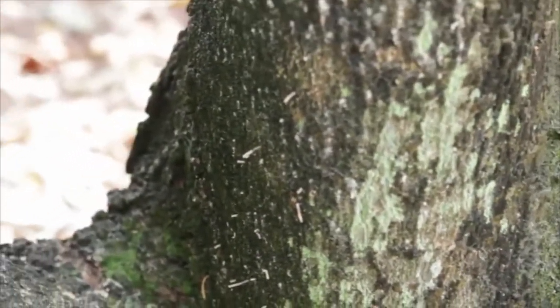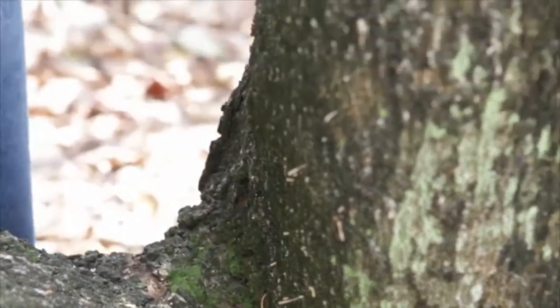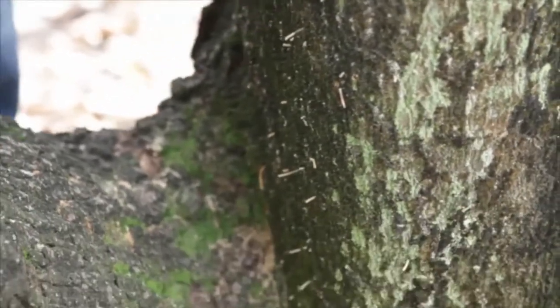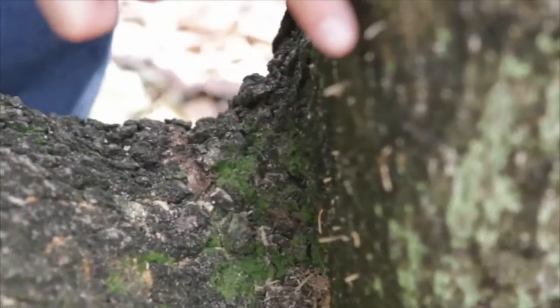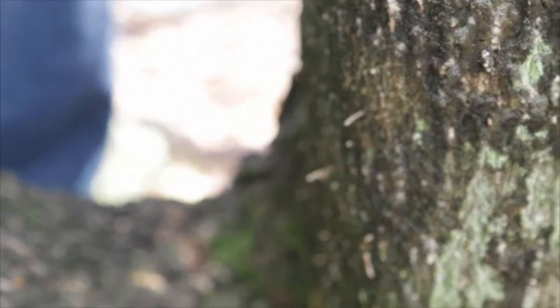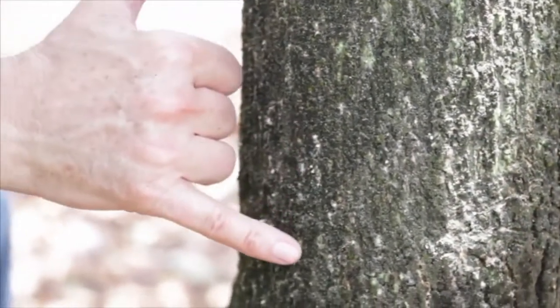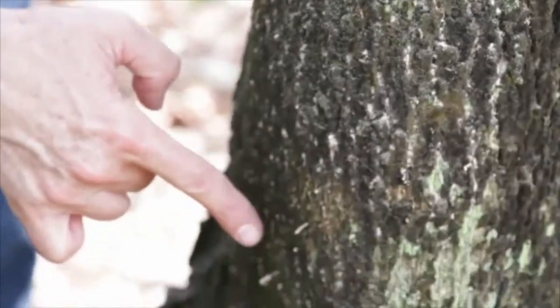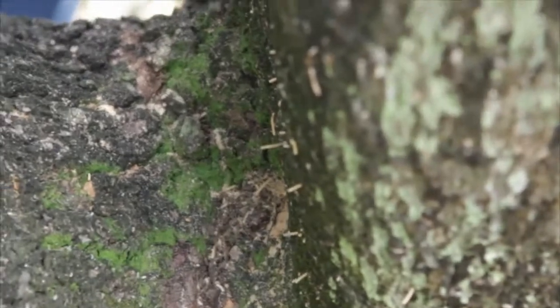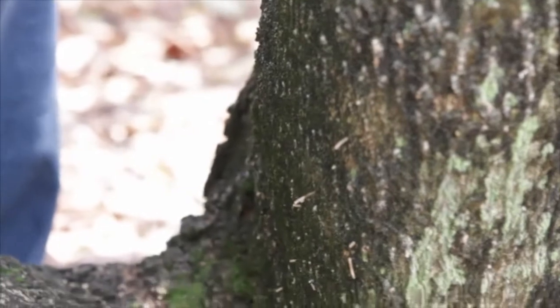In some cases when you approach a tree, you're going to see a lot of evidence of beetle boring. This is what we call little toothpicks or wood straws — this is from the beetle boring into the wood and the sawdust coming out. You'll also notice there's a lot of sawdust all over the bark, and little holes where sawdust has built up. This is where beetles have been boring into the tree, and this is the ideal place to sample for laurel wilt.